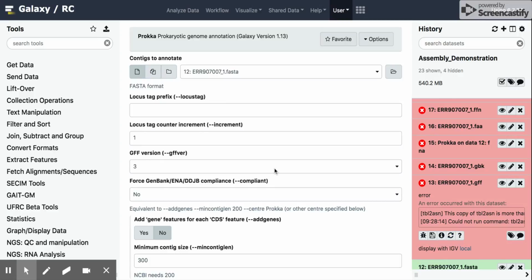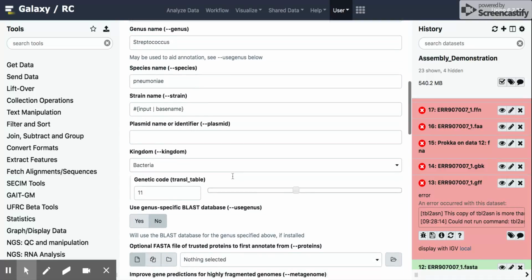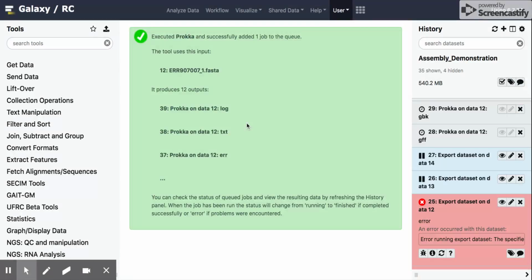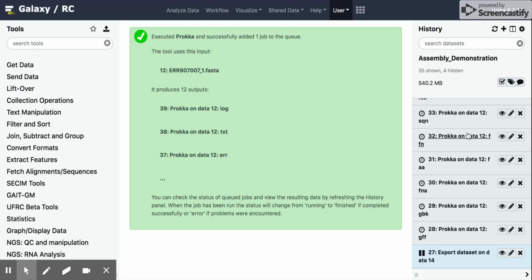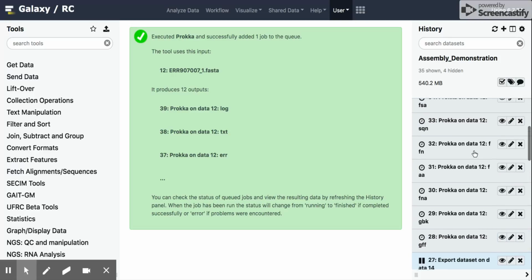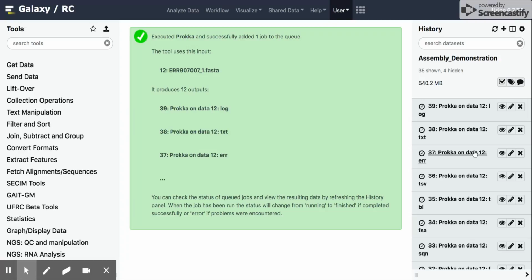It'll pull up those parameters that you set when you ran the workflow originally. We're not going to change anything here. You can see that everything's the same as before. Scroll down to the end and then hit execute. Now we can see that this is gray, meaning that the job is pending. It's about to start, and once this runs, it'll pick back up at this point and run the things that were proceeding this step in the workflow. In a moment, we should see this change from gray to yellow as it starts to run. Hopefully everything will complete satisfactorily and we can reanalyze the data that is output from this step.